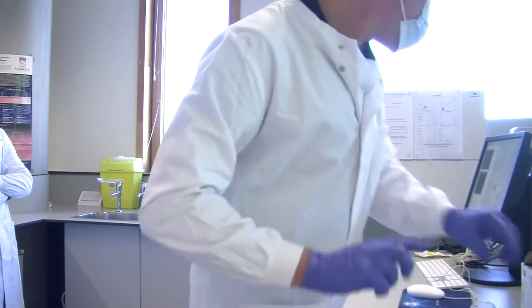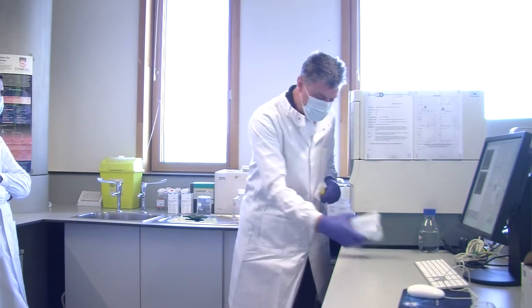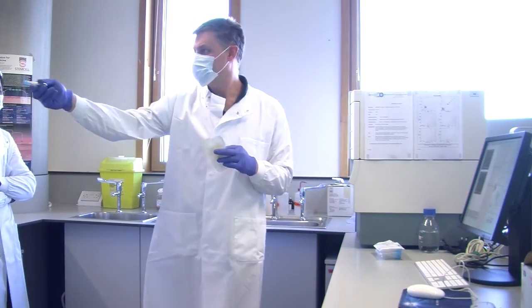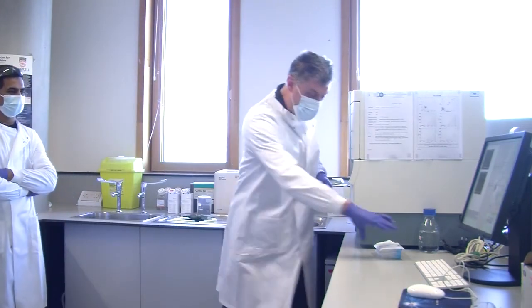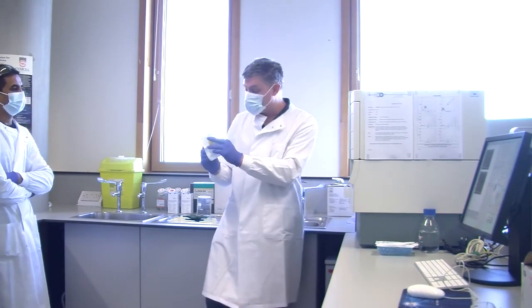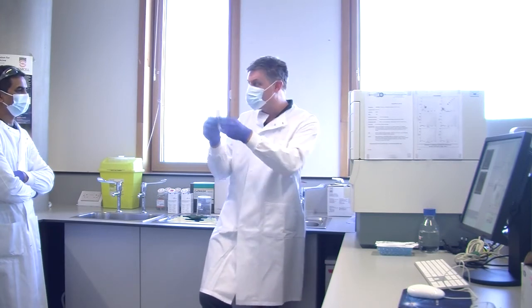Now what some people do is put them through a tube top filter. Now these tubes, if you look in there, you'll see there's a little mesh. These are flow cytometry tubes, but they have what is called a cell strainer cap. So you can take the sample onto the top there, tap it through, and any big lumps are held in the mesh. You can also buy separate tube top filters.